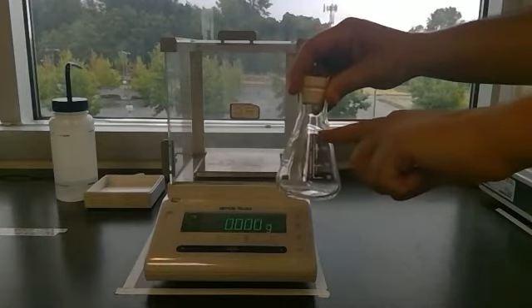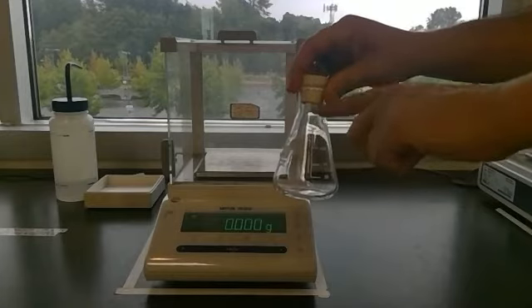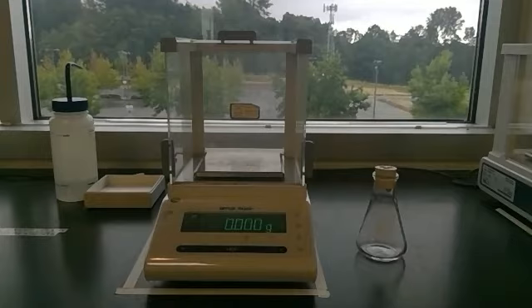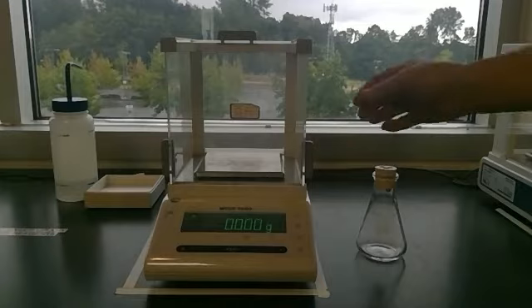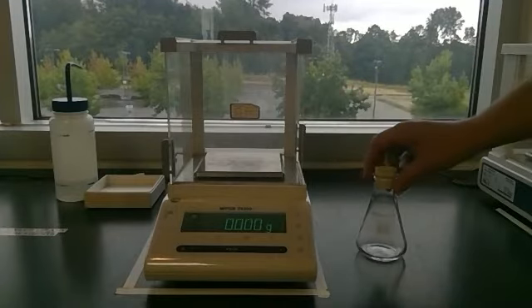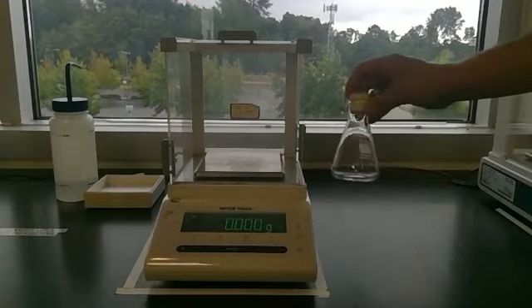That will be about here on the flask. There's still a lot of space here. So to determine the actual volume of it, we're going to need to fill it with water and determine what volume of water was inside the flask. So I'm going to do this using the density of water so I can be as accurate as possible. I don't have anything that will measure volume as accurately as this scale will measure mass.